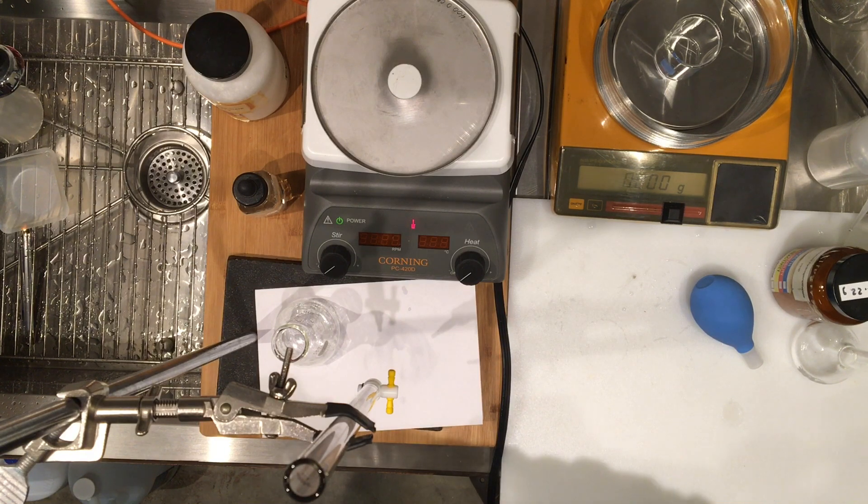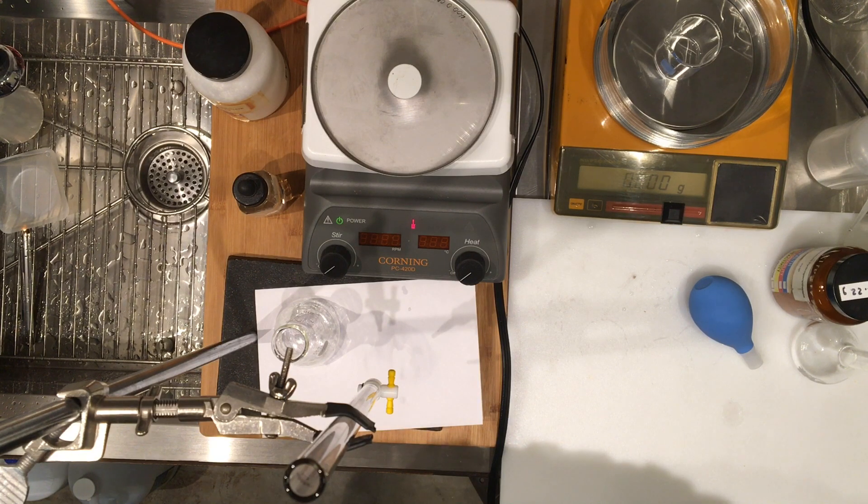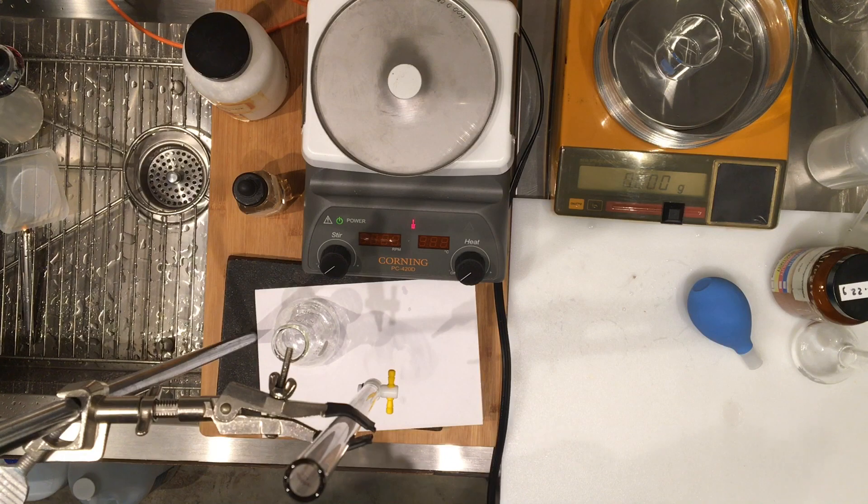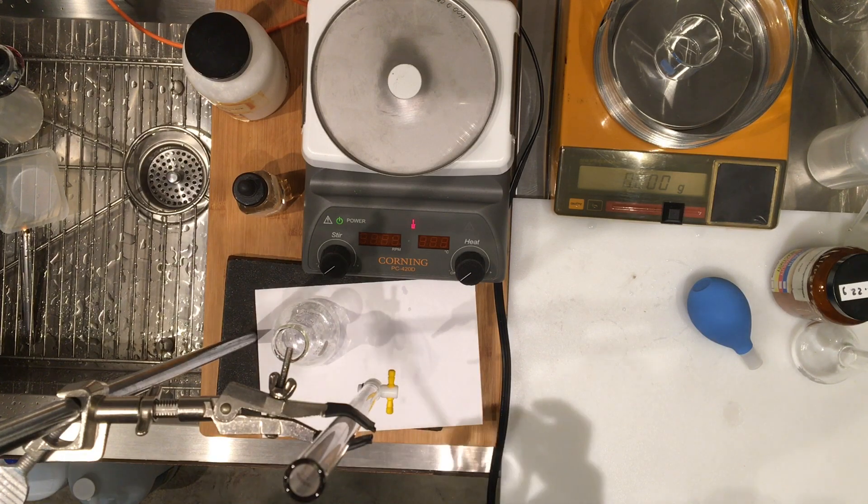So I do have to dilute this vinegar down, and then we can use the dilution factor, or volume initial and final volume, and figure out the original molarity and percentage of my solution. So we'll figure all of that out later.